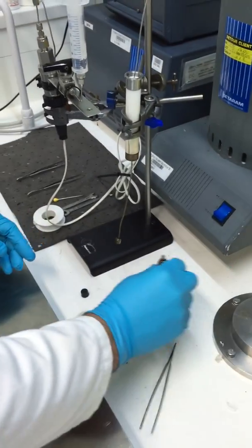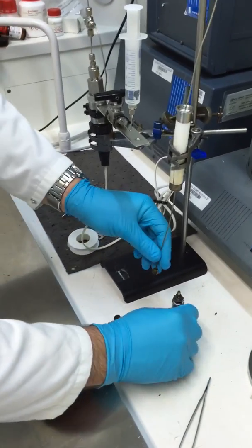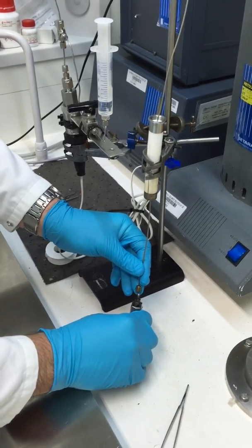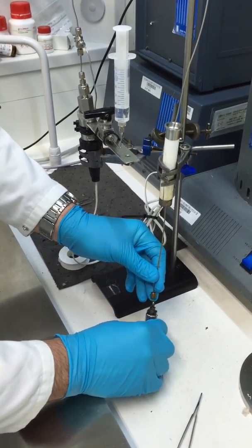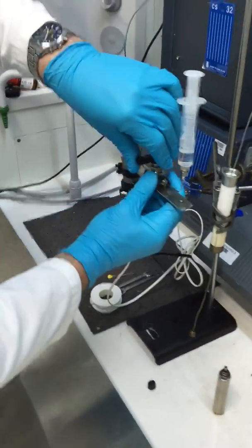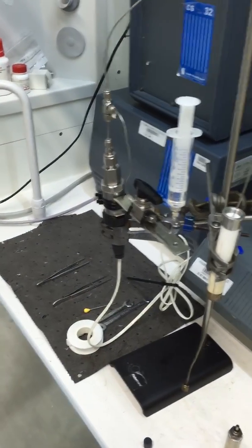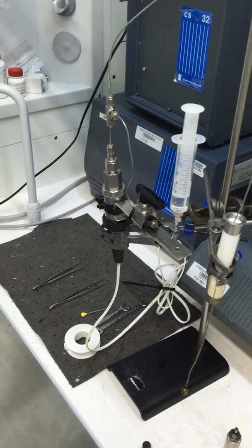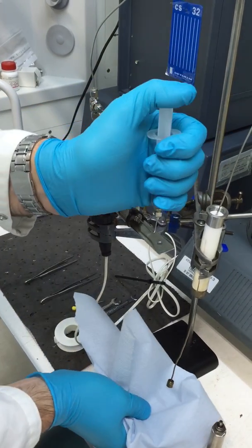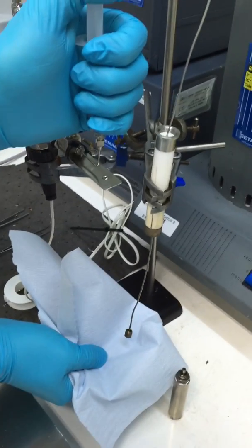We then take that and connect it up to the oil-filled line. The oil-filled line would have been cleaned by running the oil through the tap, which Trevor will demonstrate now. We open the tap and squeeze some oil through the line.